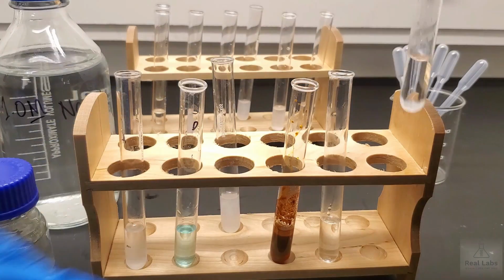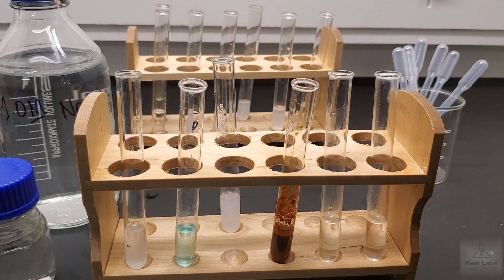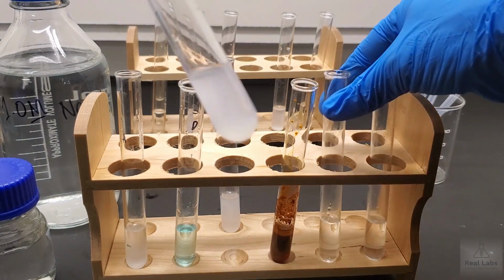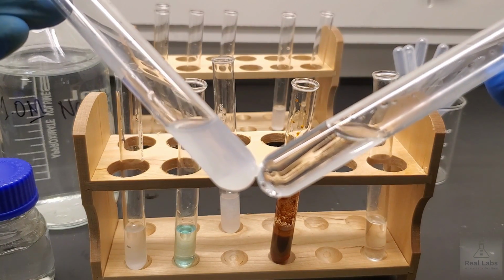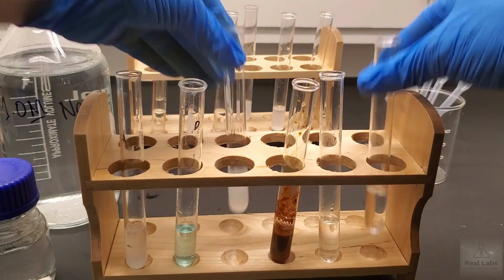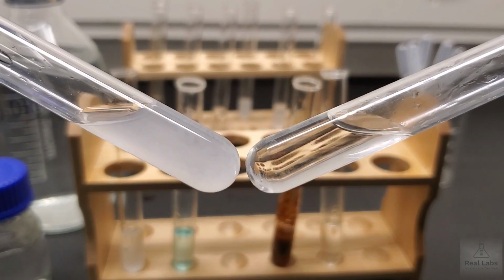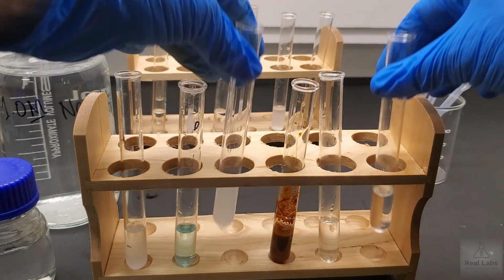So both of those reactions with the sodium hydroxide do in fact create a system that gets a little warm, but there is no precipitate. So you can see clearly the difference between the original HCl reaction and the one with what should be now the cleaner, purer sodium hydroxide. And if we look at this comparison the same with the nitric acid, you can see too in that instance, now this is what we expected to see on the right.